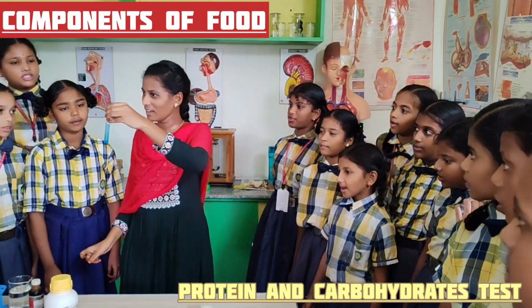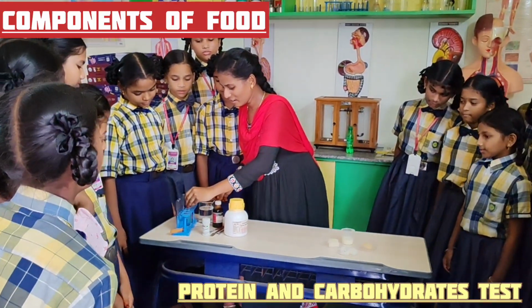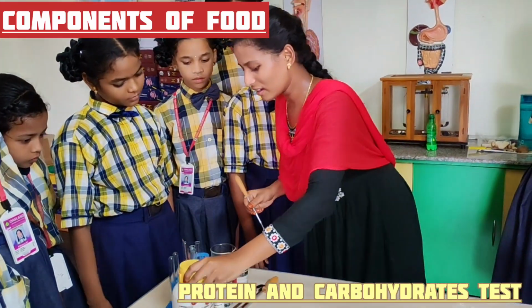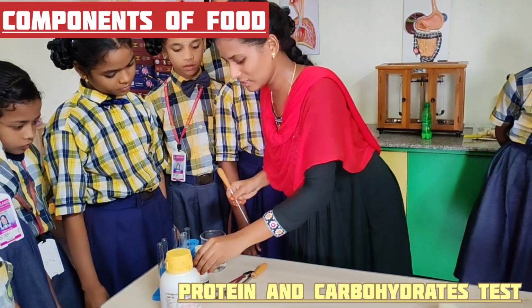Sodium hydroxide solution. Now, with the help of a dropper, we have to add all the solutions to the food material.